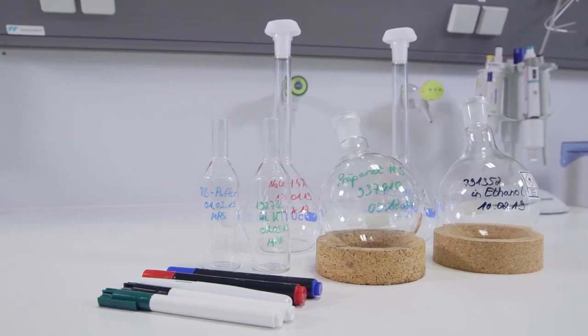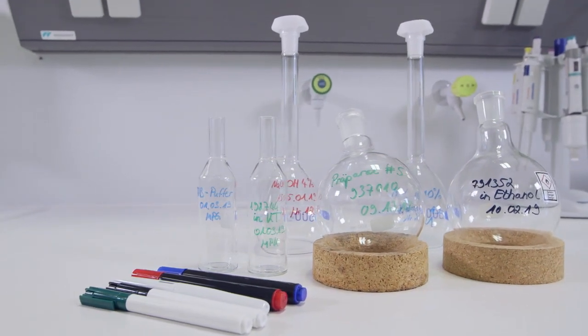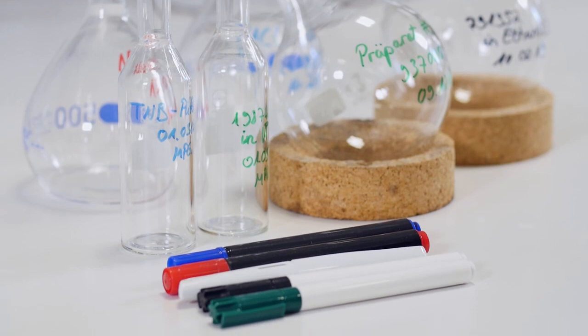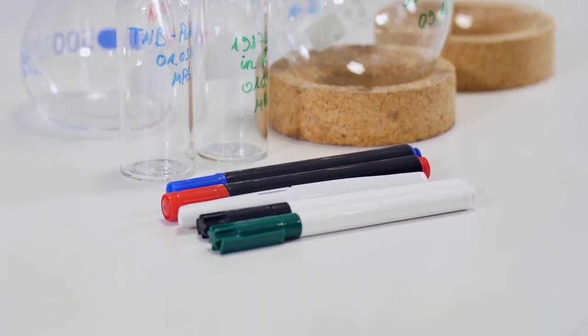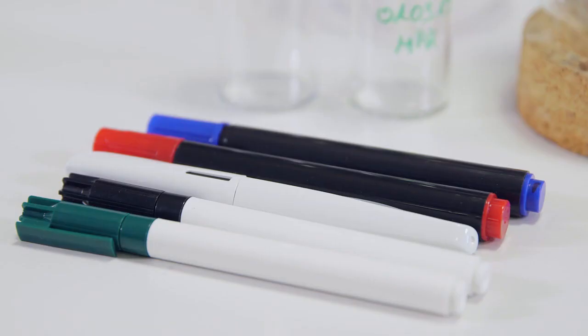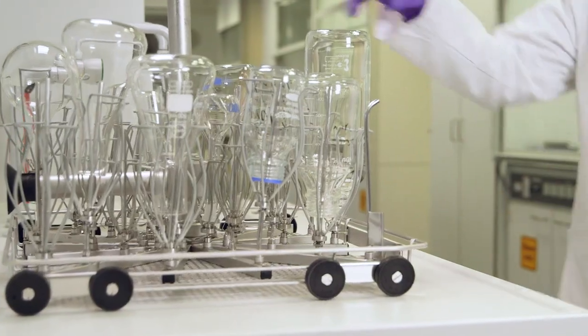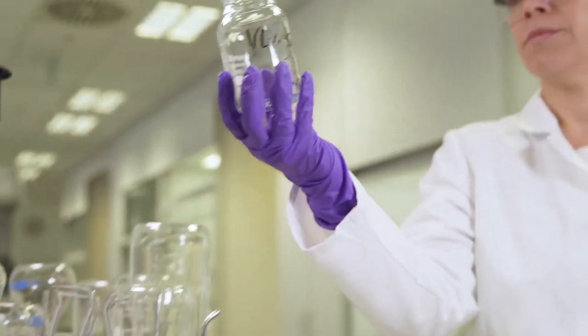Laboratory glassware is often labelled for identification purposes. Various markers and colours are available for this, consisting of different pigments. The residues of these pigments are often very difficult to remove.